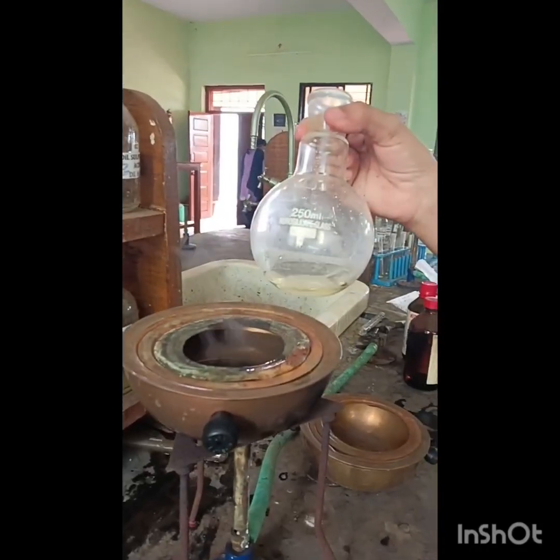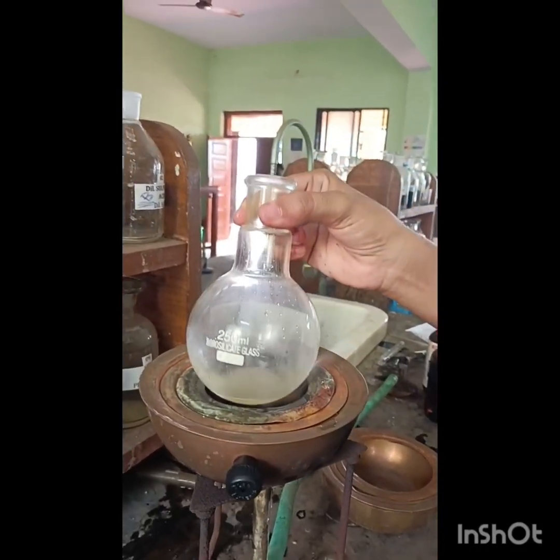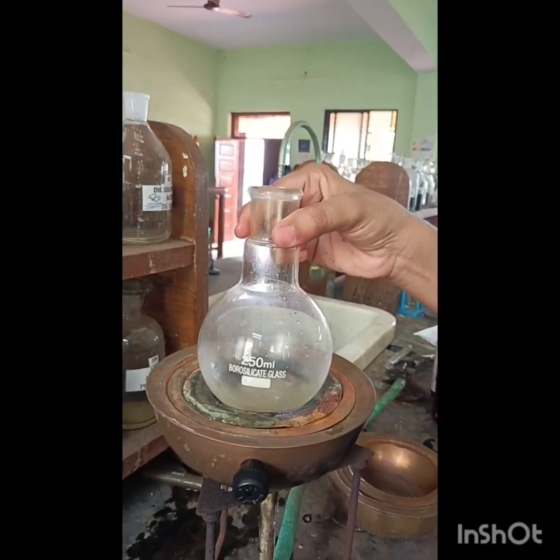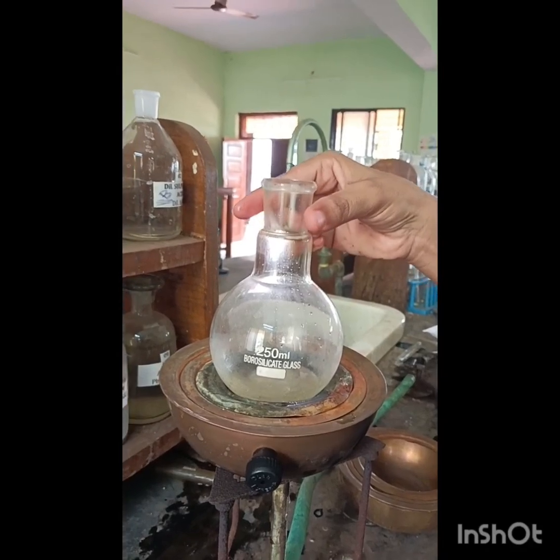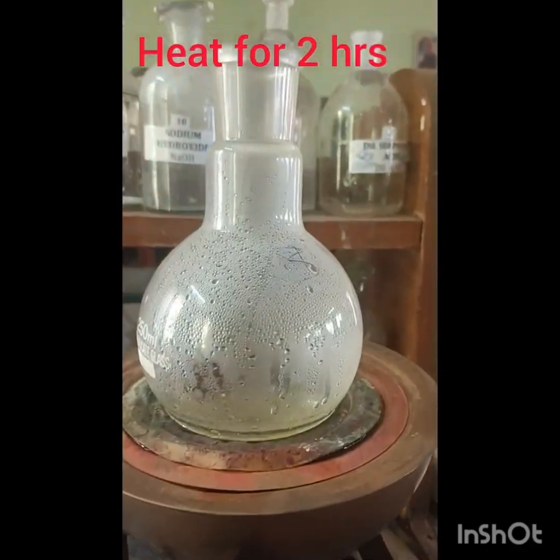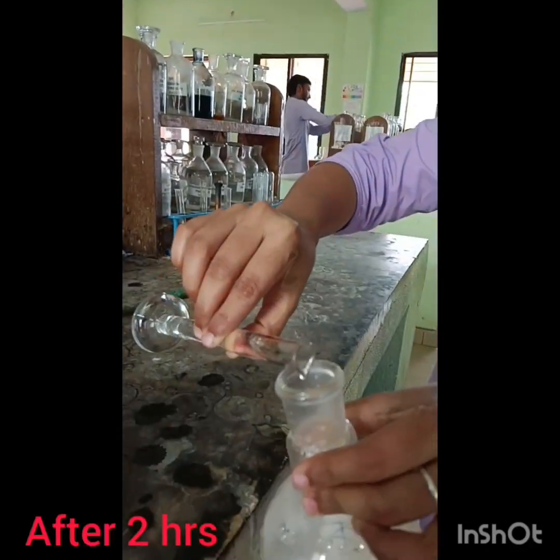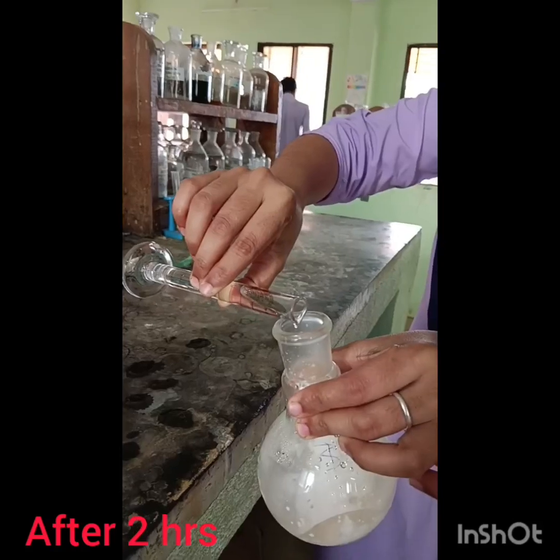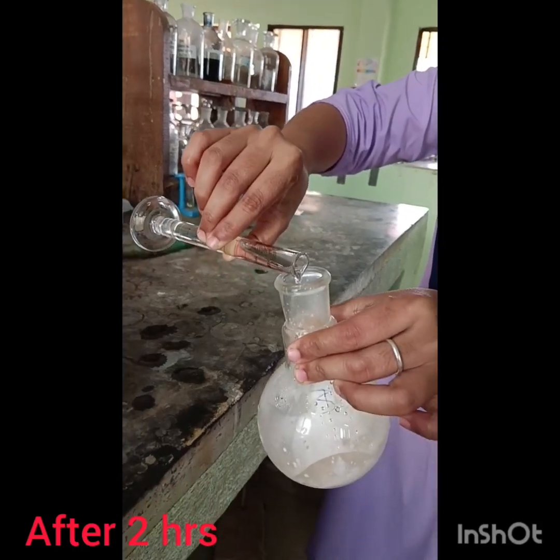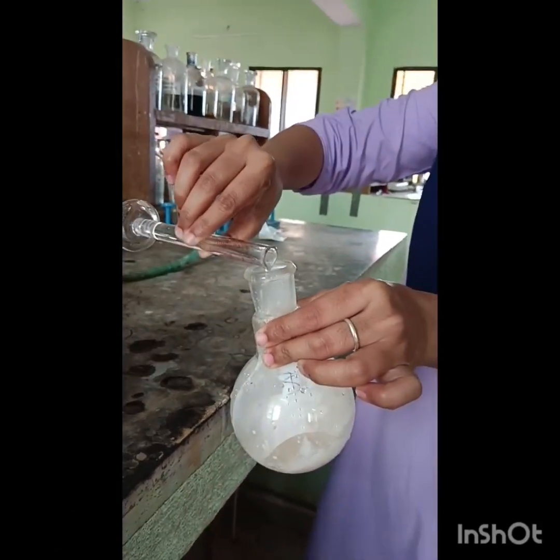Now this is heated on the steam bath for 2 hours. Then add acid to the solution contained in the round bottom flask.